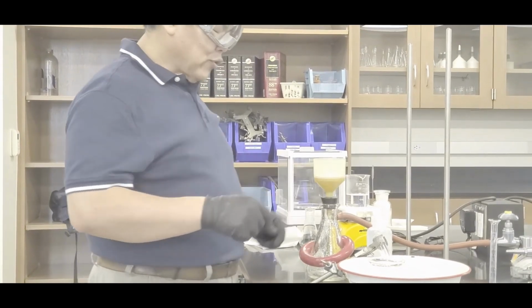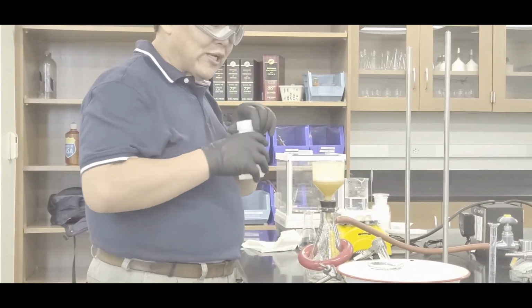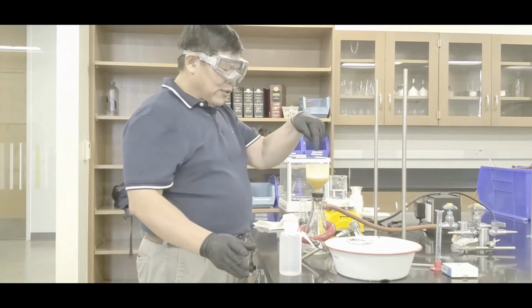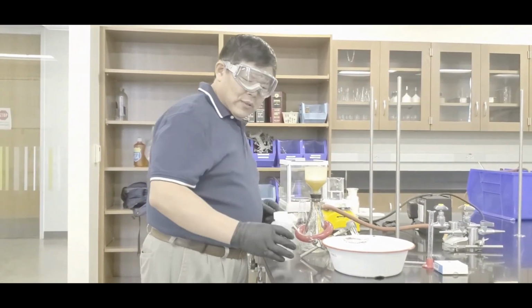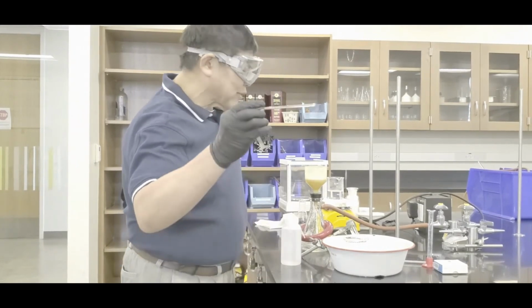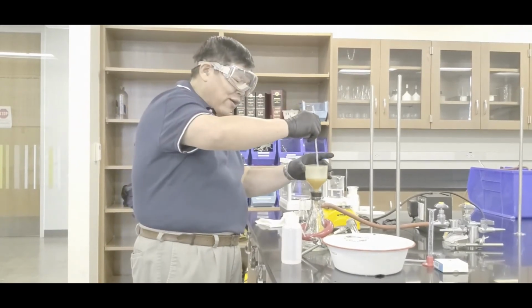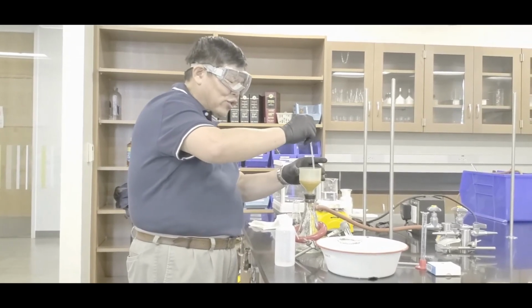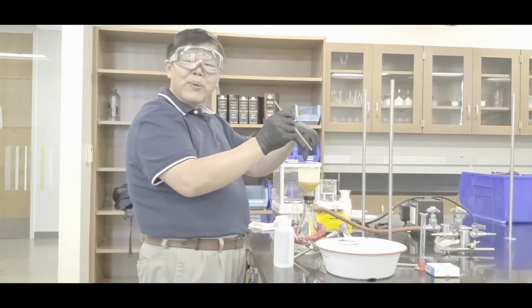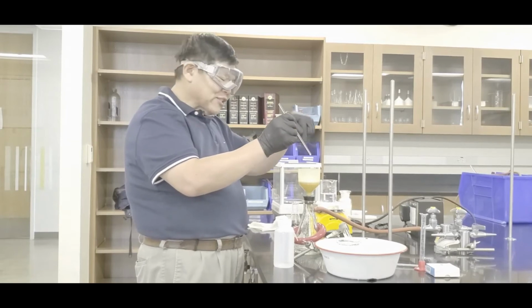All right, so in that case, meanwhile, what you want to do is this. You want to tamp down the filter paper. So use a squirt bottle to wet the filter, and then push down on the edges of the filter paper. Because you want the liquid to go through the paper, and you want the aspirin to get stuck on the paper.